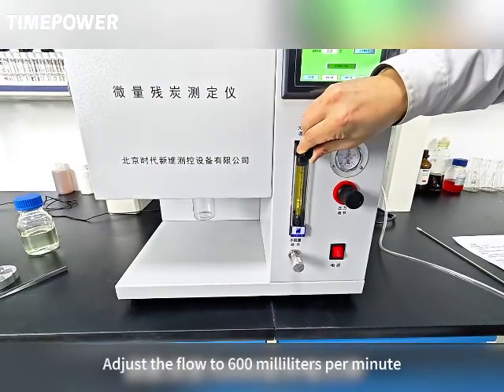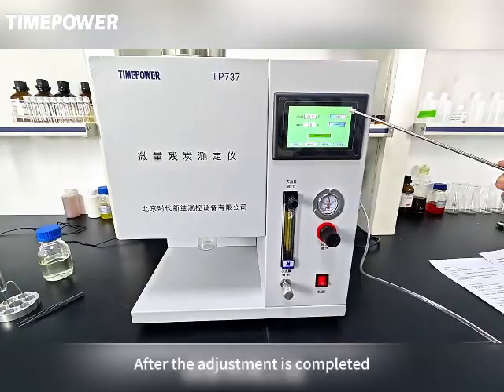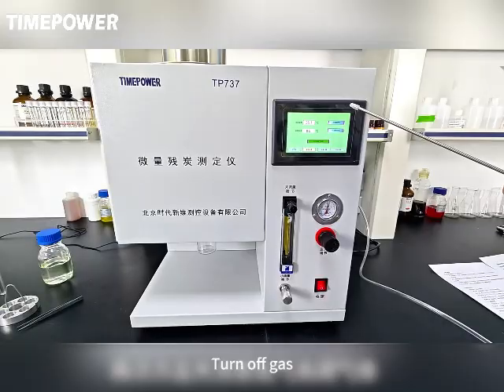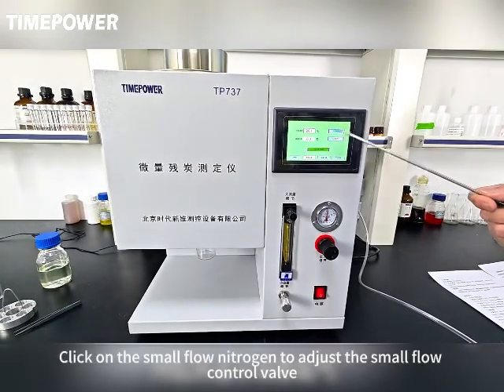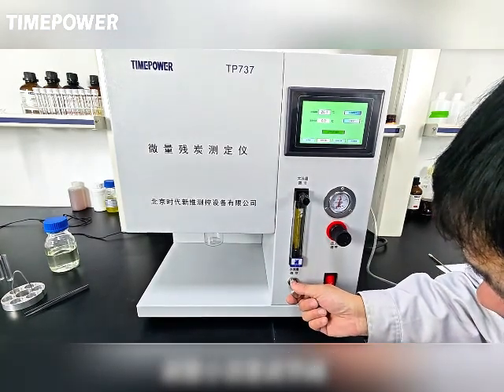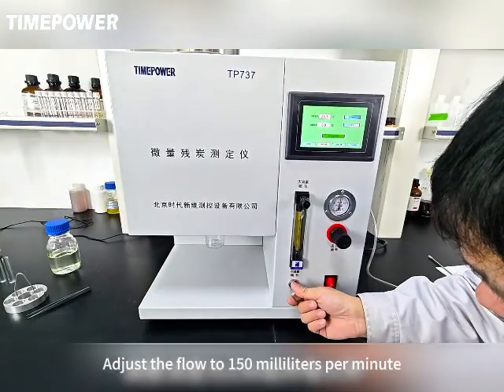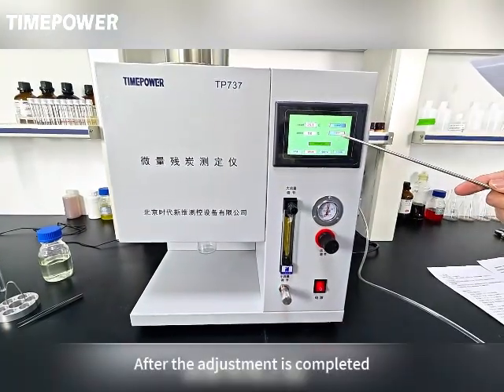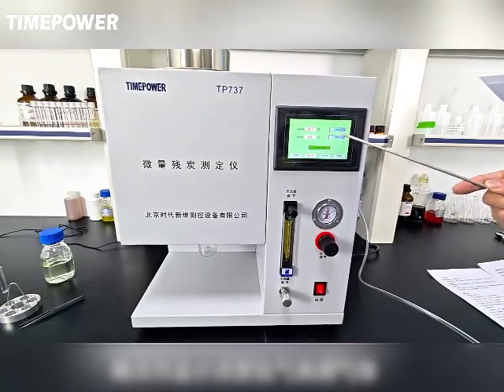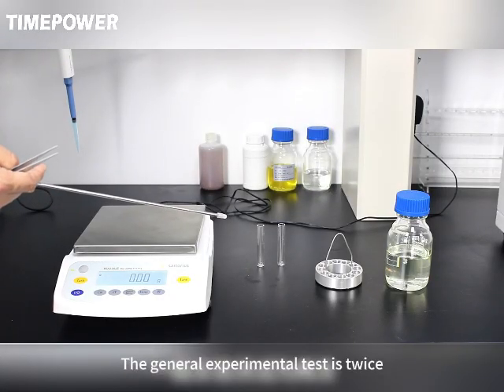Adjust the flow to 600 milliliters per minute. After the adjustment is completed, click again on large flow nitrogen to turn off the gas. Then click on small flow nitrogen to adjust the small flow control valve. Adjust the flow to 150 milliliters per minute. After the adjustment is completed, click on small flow nitrogen again to turn off the gas.